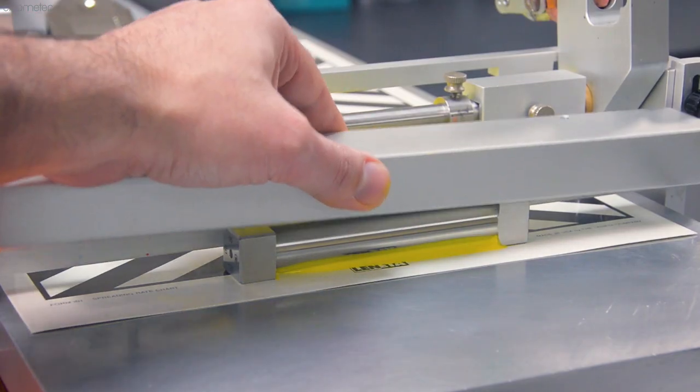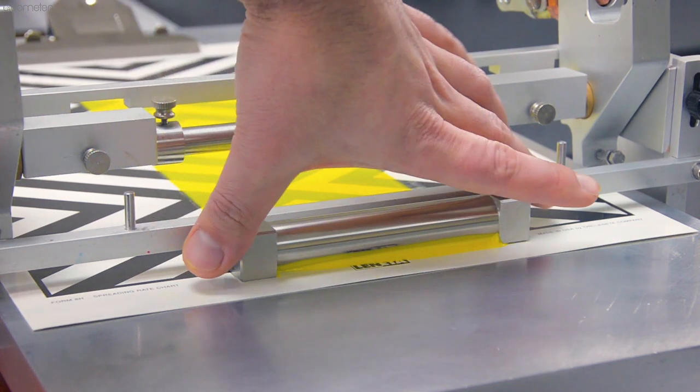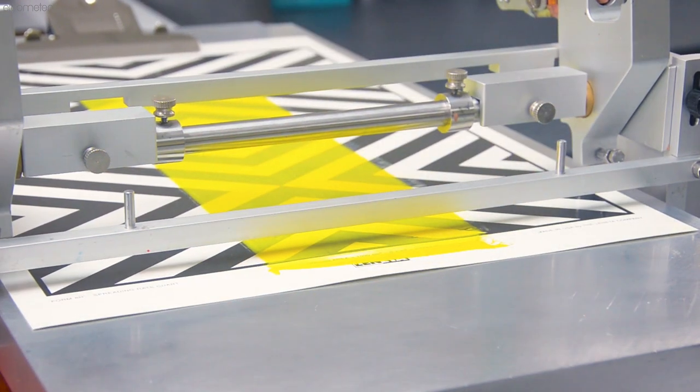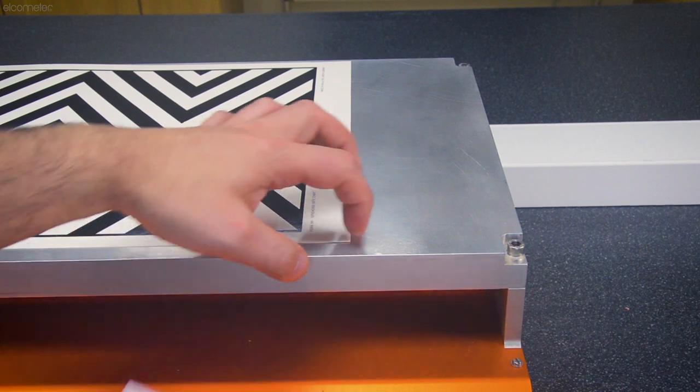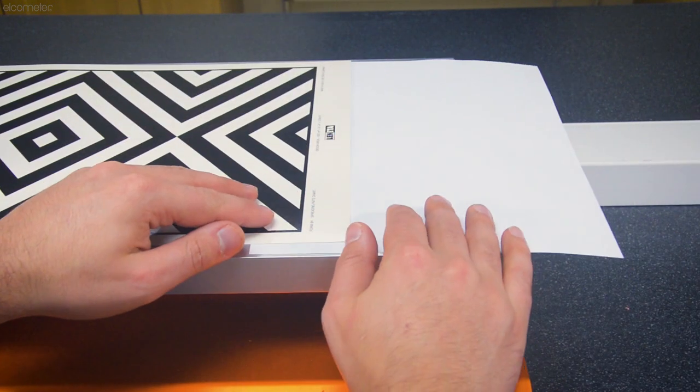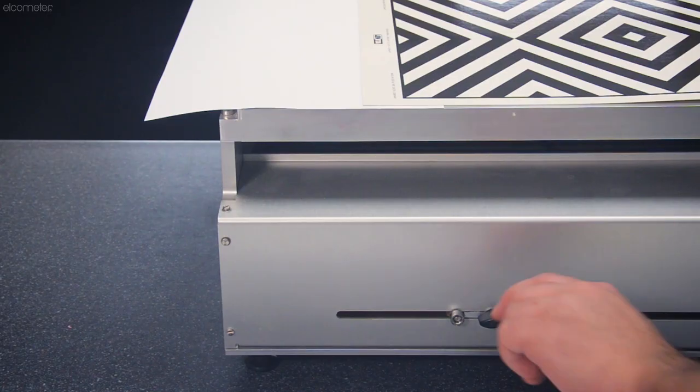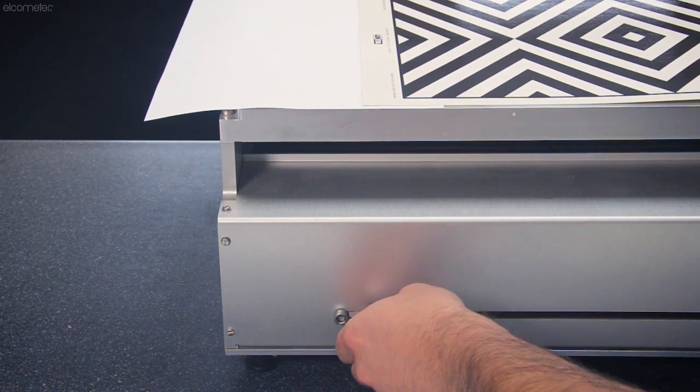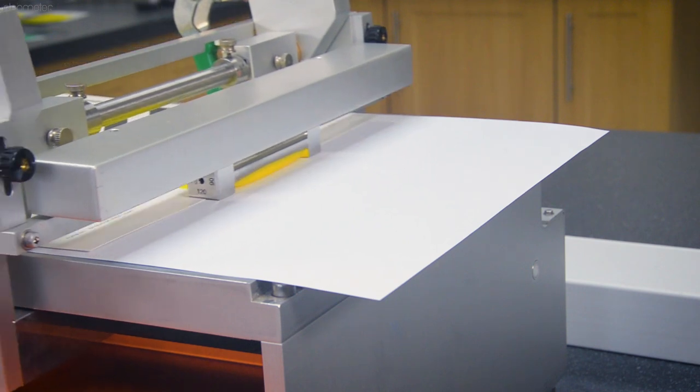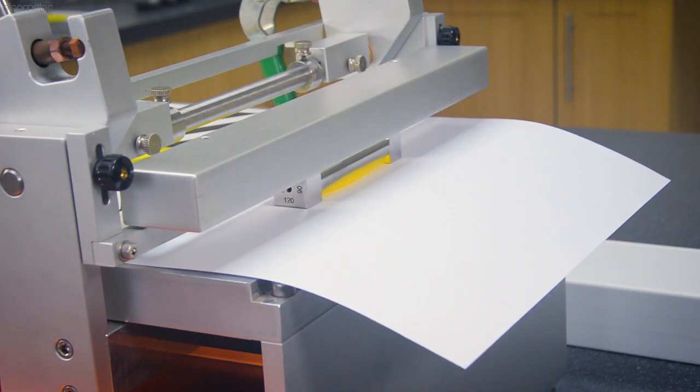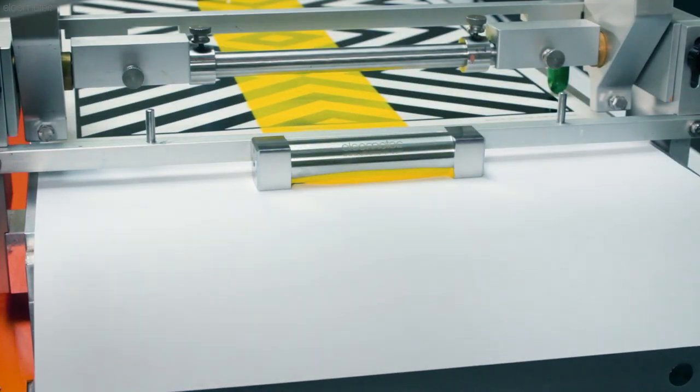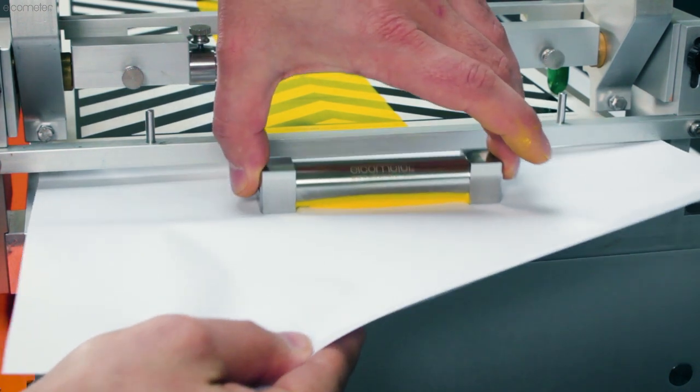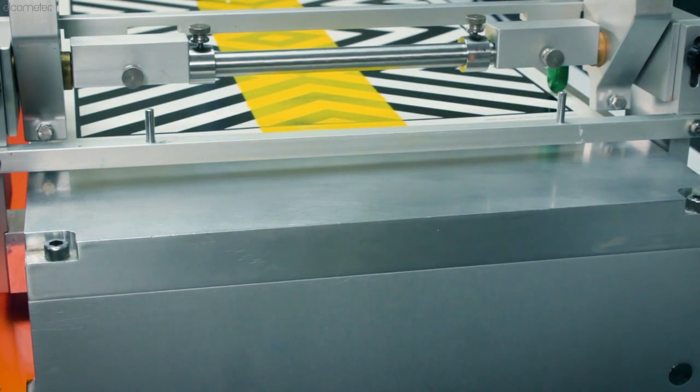Upon completion of the film, remove your applicator immediately to avoid any excess product dripping on the substrate. One way of making this process easier is to place a thin sheet of paper under the end of your substrate and ensure the stop position of your carriage goes beyond the length of your substrate. This way, all of the excess coating is pushed onto a sacrificial piece of paper, which you simply remove once the film has been created, avoiding any spillage onto the substrate or the test bed underneath.